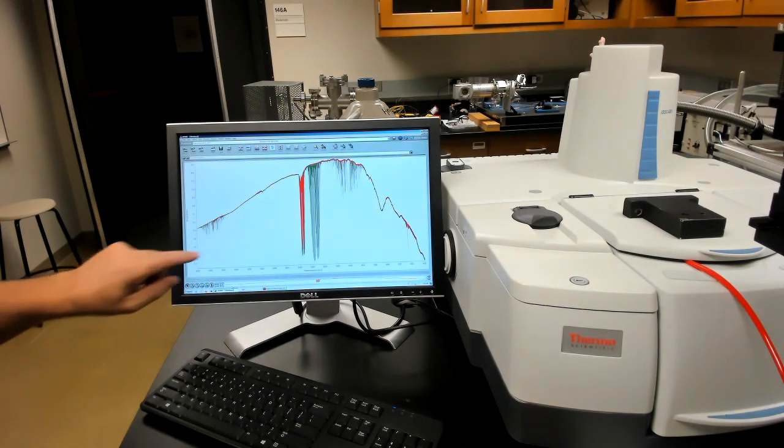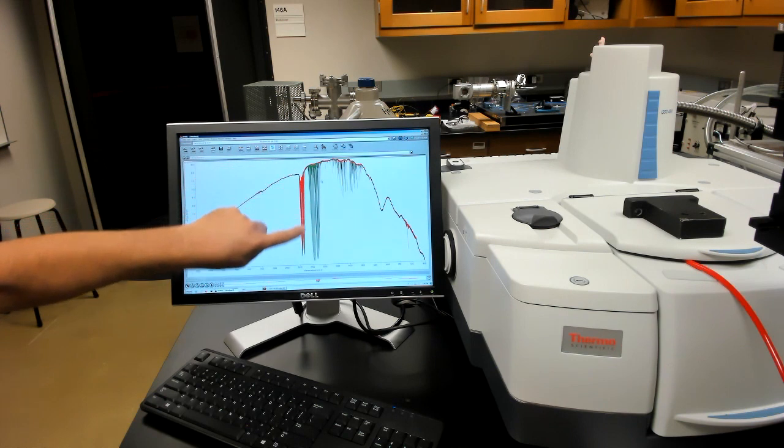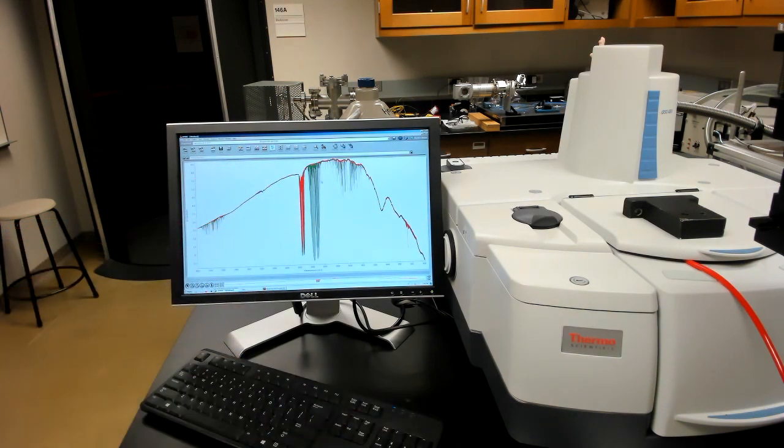Now the last thing that we're going to do is we're going to take the ratio of the sample spectrum to the reference spectrum, okay? That'll take just a second, but it's not that interesting to see how one makes the software do this. So I'll just skip to the result. One second. Okay, we're done.